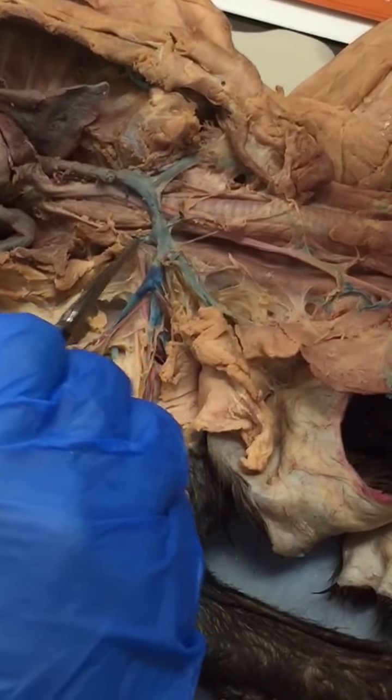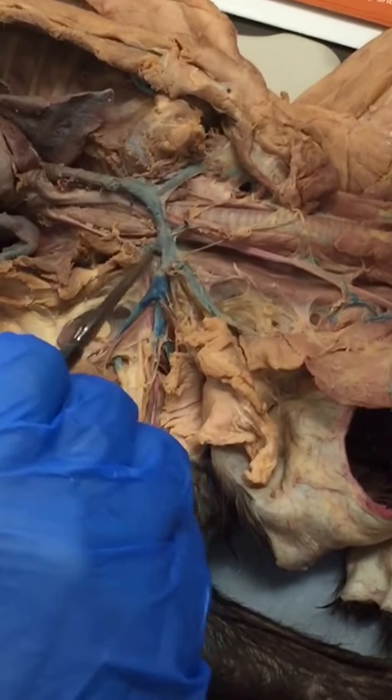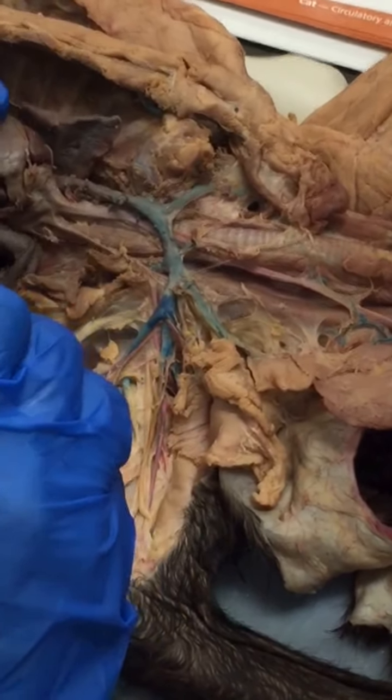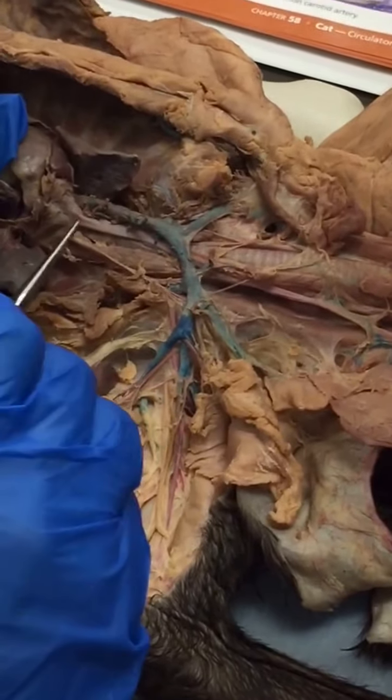and vertebral here. Can you see, Tim? You close enough? Yeah. All right, so then to jump back into the arteries.